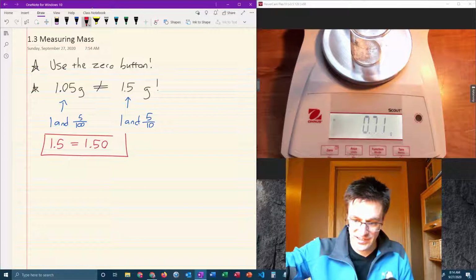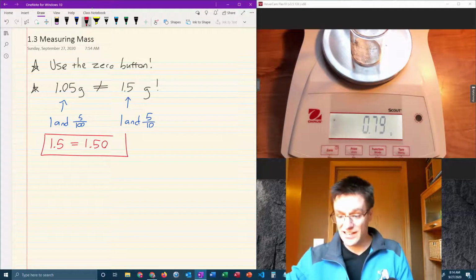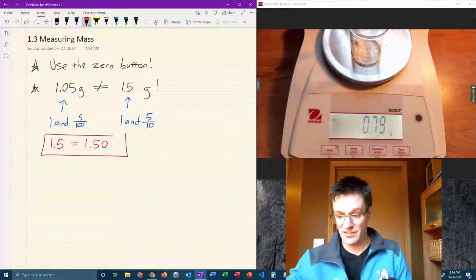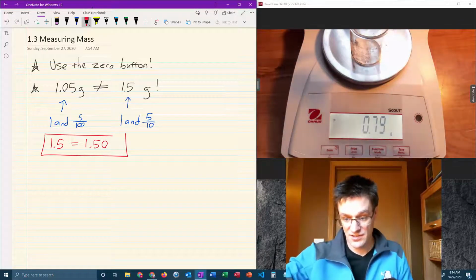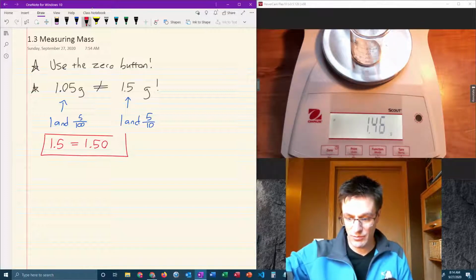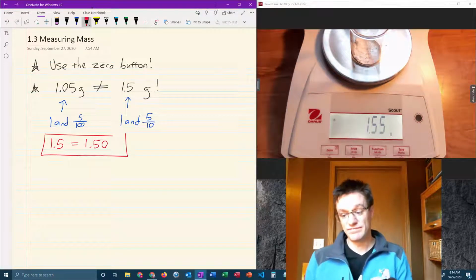Now I'm being careful not to get any solid onto the platter. If I get any solid onto the platter, in fact I did just a tiny bit, little powder there, that's probably about 1/100th of a gram. That's not in my beaker. So that's a little bit of an error that I made, but not too big. And you can see I'm trying to get up to 1.50. And already I went a little bit over.